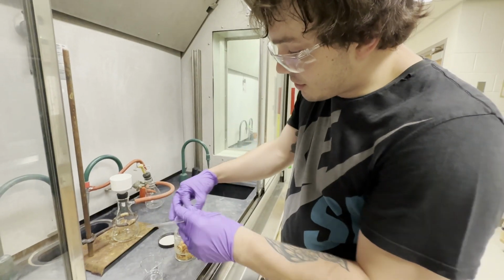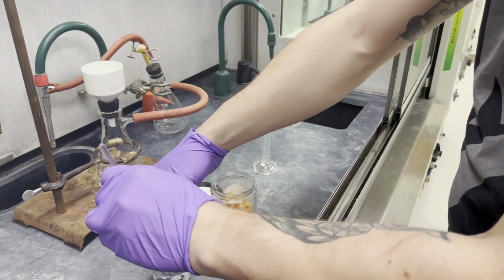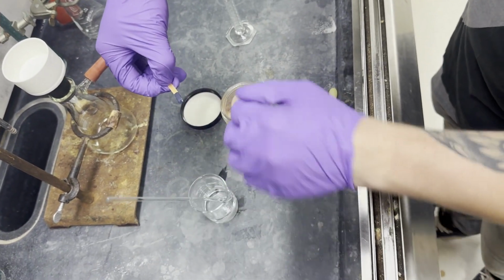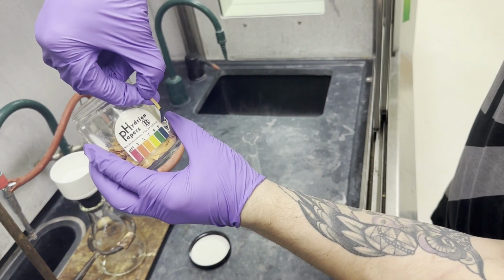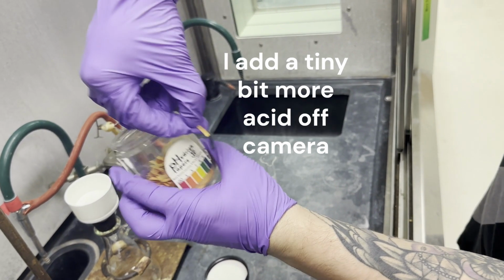Now I don't see very much product formation, so I'm going to go test the pH and maybe add some more. Here's our pH paper. We're just going to get this glass stirrer wet and then test it, and then you see this very dark blue, which is indicative of a very alkaline solution. So we're going to have to add some more hydrochloric acid.